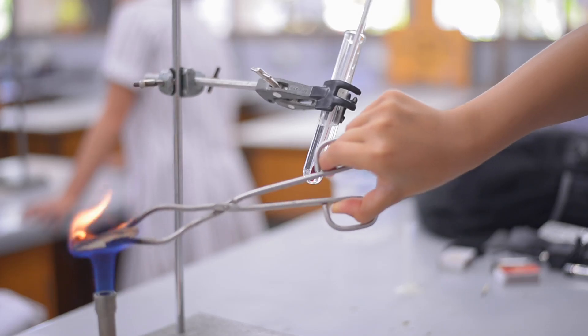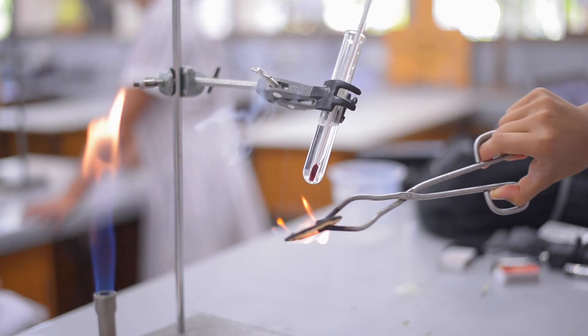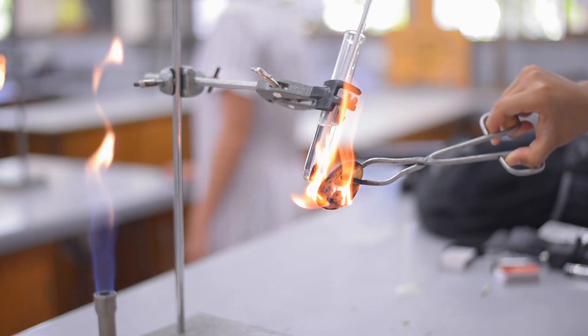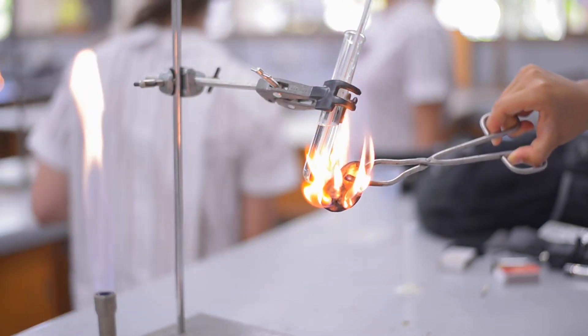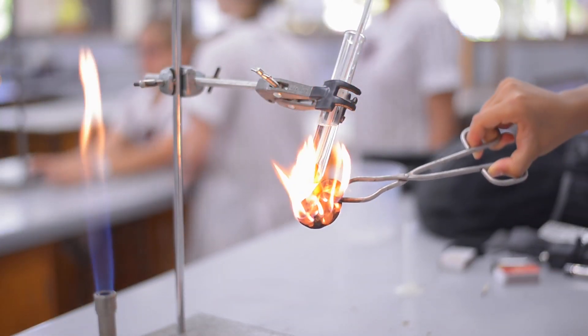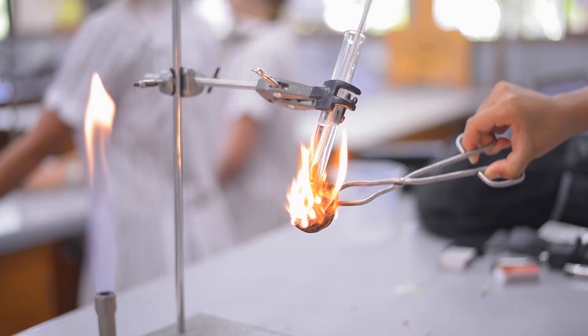Let's take a look. Come on, biscuit, you can burn. There we go. We're going to maximize all of its energy. This is terrifying. Hold it completely underneath the test tube. We want to maximize... This is so intense.